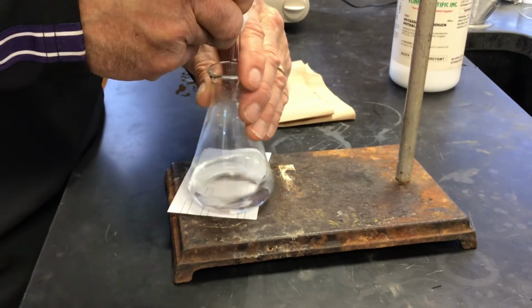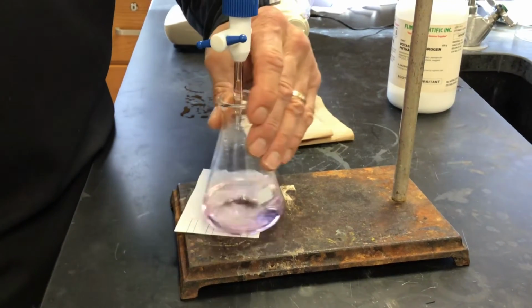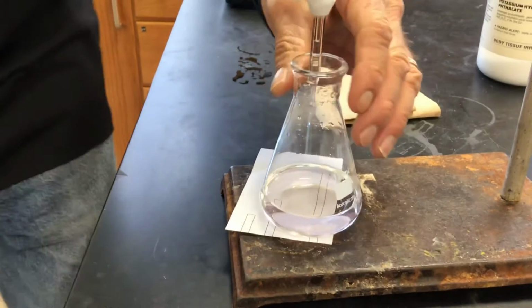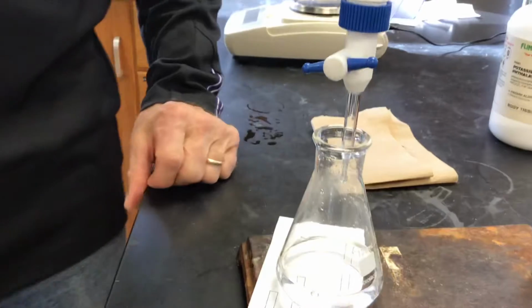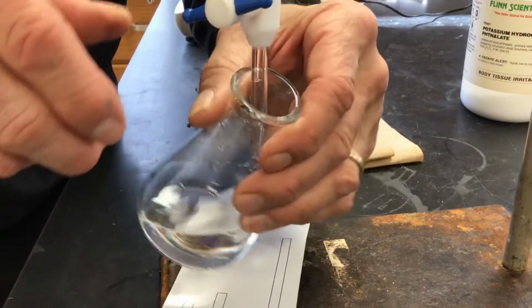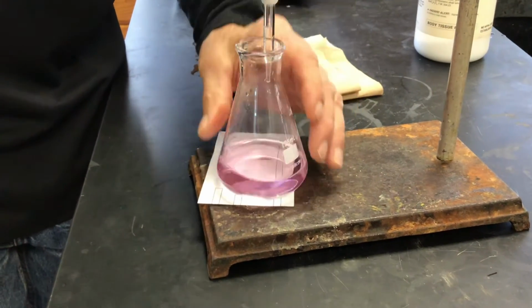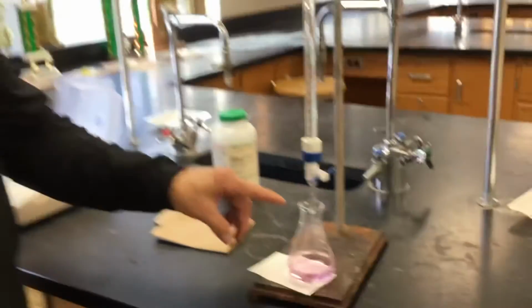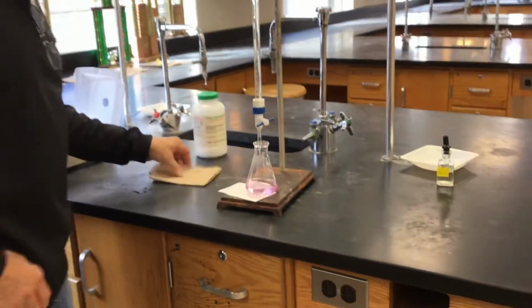Okay. Is the pink still there? Yeah, it is. There is a little bit hanging off the tip of the burette. If you run that down the side, I think that'll make it go pink. See how close we were to the end point. Good. And actually, that was legitimate to do because that drop had actually already been measured. Yes, that's what the burette is measuring.